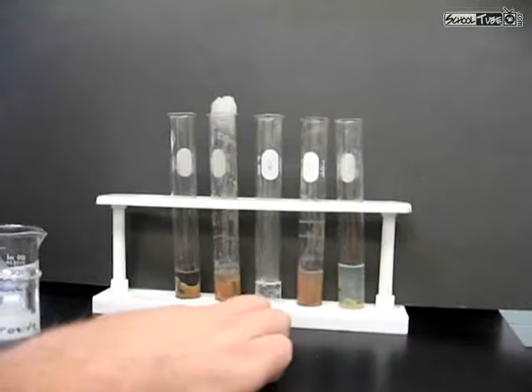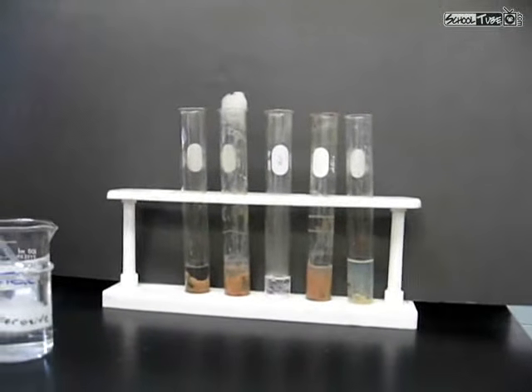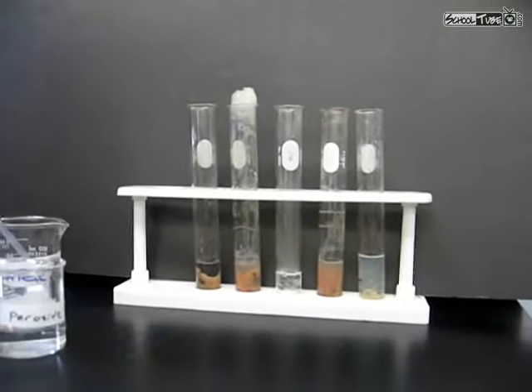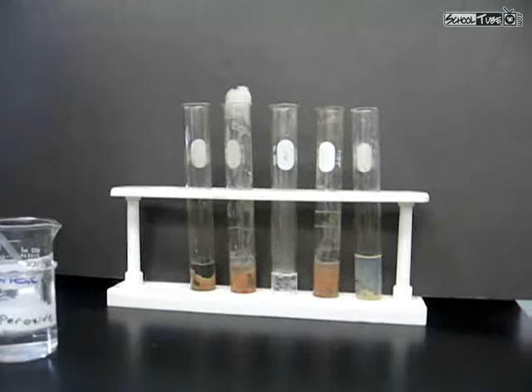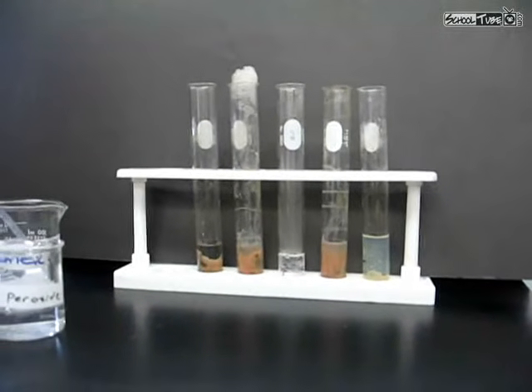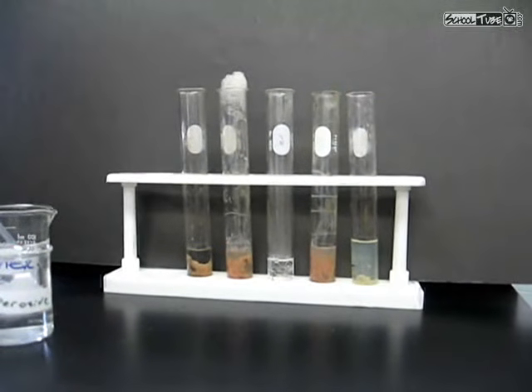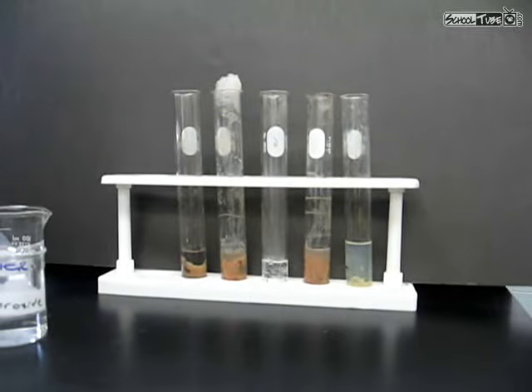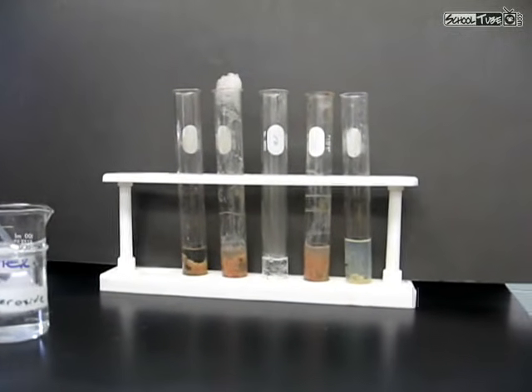The third one, we lit the wooden splint into the test tube of peroxide, and we found out that peroxide is not flammable, so that when we did the fourth test, we knew that during the reaction that oxygen was being given off because it did reignite the stick, the lighted splint. And then our fifth test tube had the boiled liver in it. The enzymes didn't work, and we proved that because when we added the peroxide after it had been boiled, there was no bubbling.